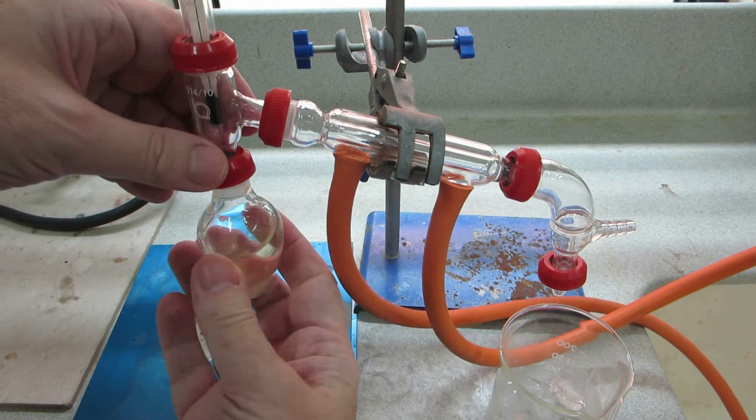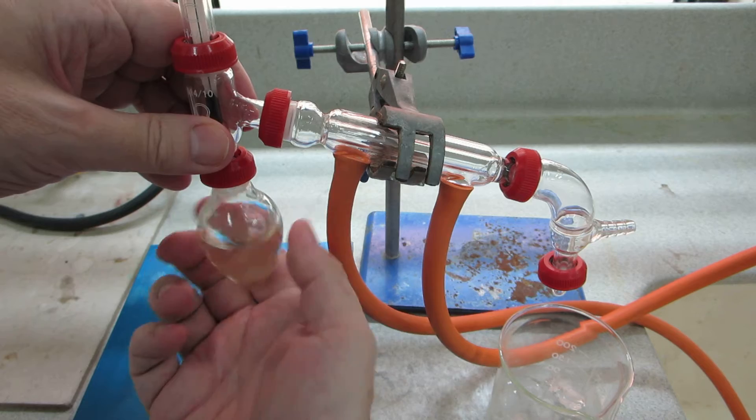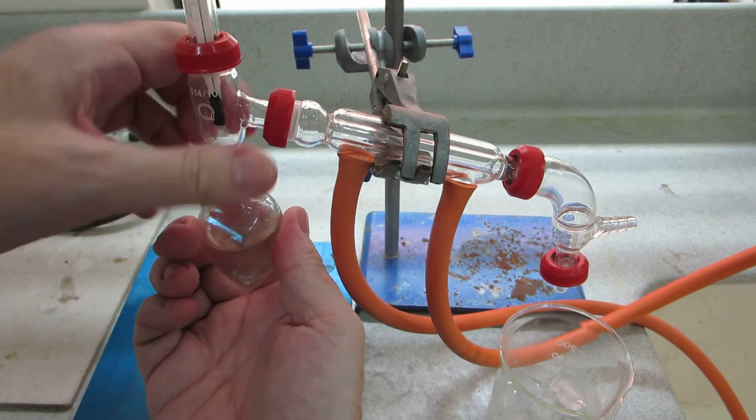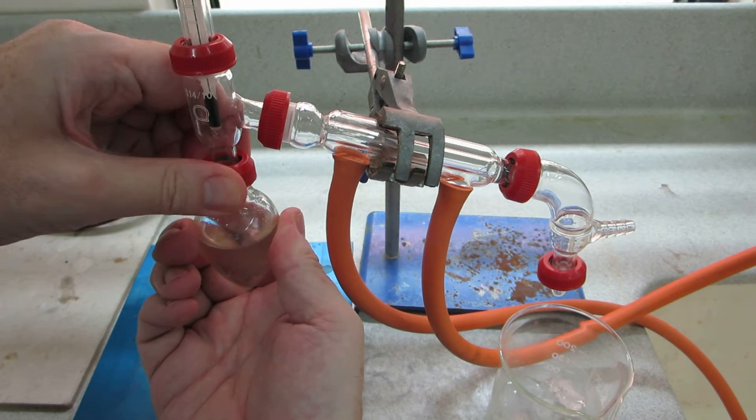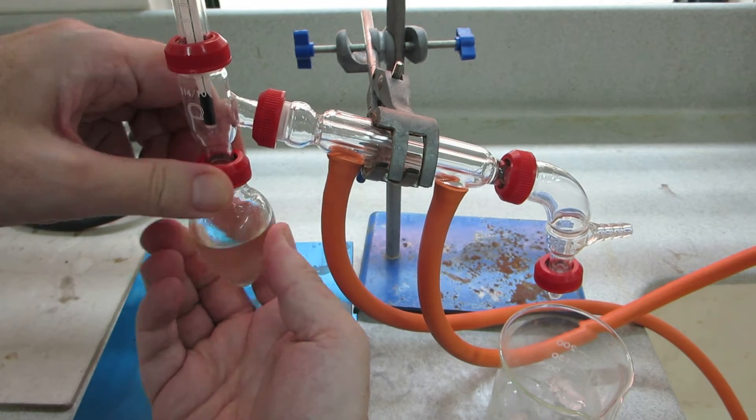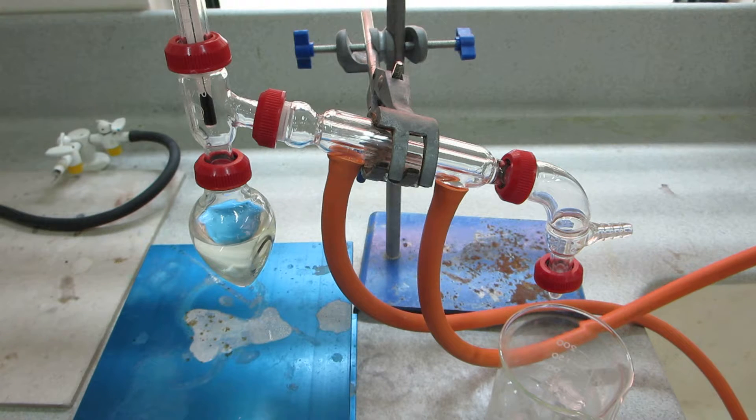And attach that to the distillation arm. Like so. Making sure that's a nice secure join there.